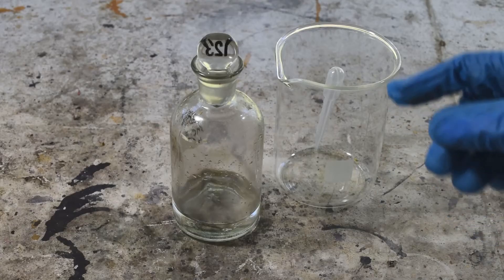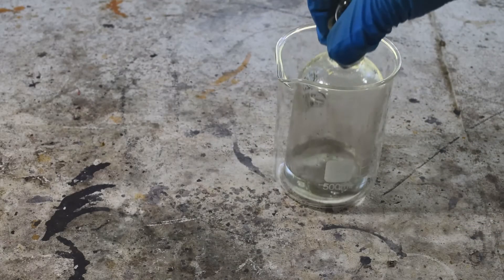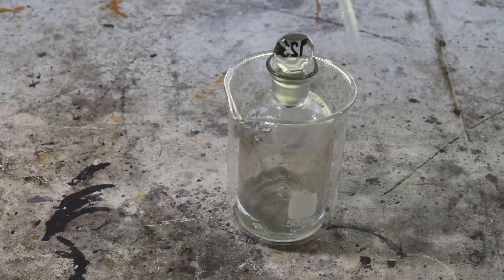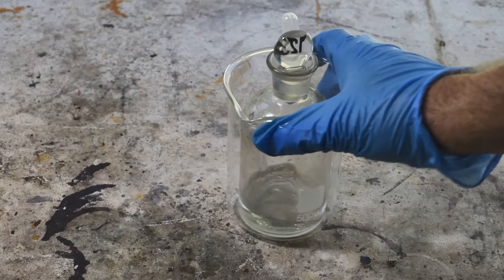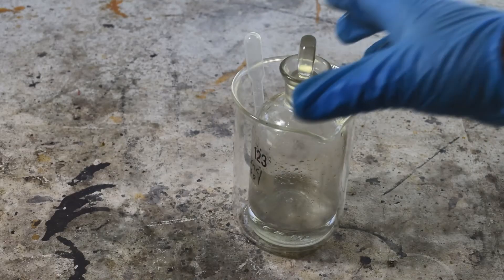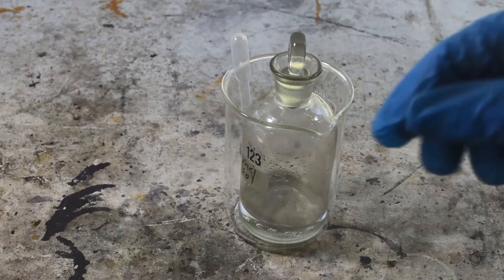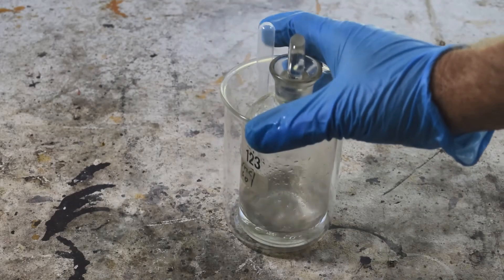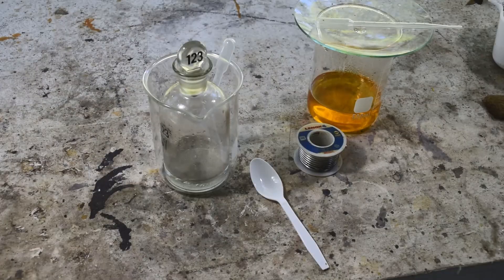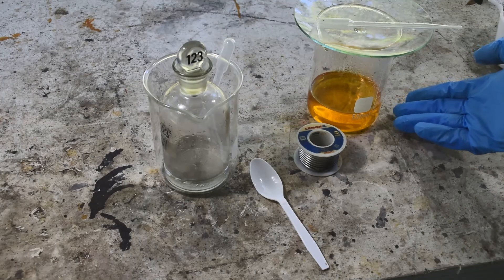I like to take the ground glass bottle, put it in a spare beaker, and keep the dedicated pipette in the beaker with it. That way I've got my stannous chloride stuff ready to go on a moment's notice — I don't have to fish around for a pipette or anything. It's all right here, ready to go.